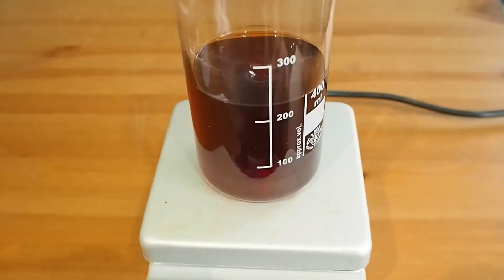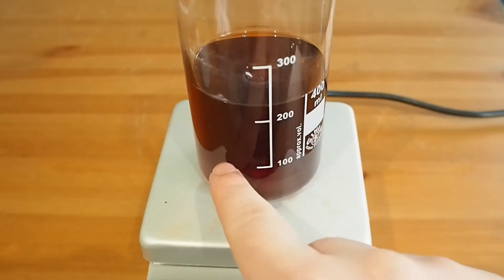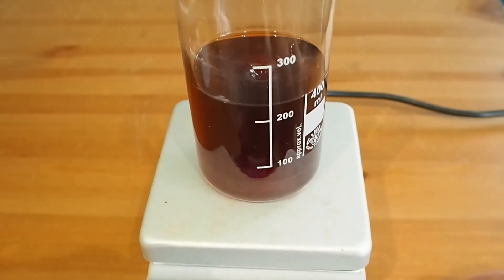So what we're going to do is isolate some of the iron 3 acetate from that solution and have a look at it. I want to reduce this down by about two thirds until we've got about that much liquid, and then see if we can get some iron 3 acetate to precipitate and collect that as one of our iron compounds. So let's ramp the heat up and let this evaporate away.